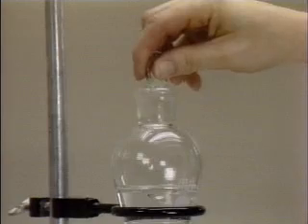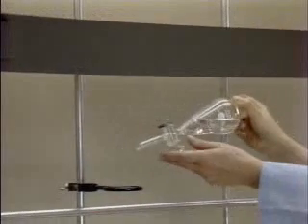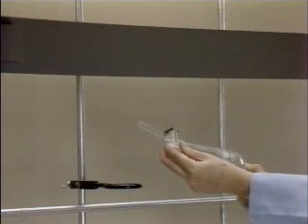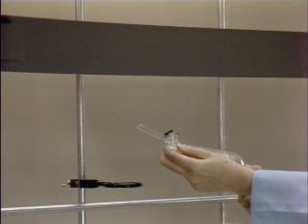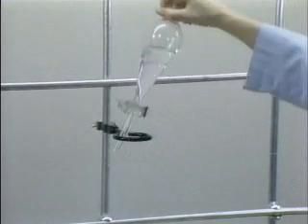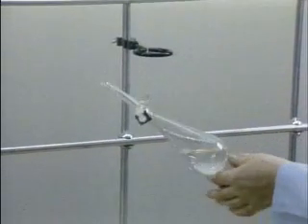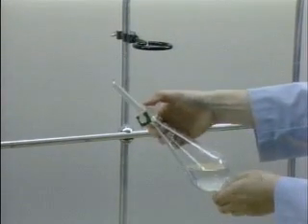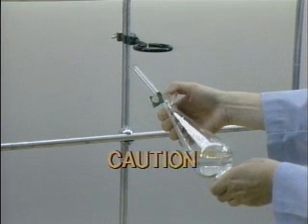The top of the funnel and stopper are grasped tightly with one hand, and the funnel is lifted from the ring stand. As soon as the funnel has cleared the ring stand, the other hand is placed around the stopcock to prevent it from falling out. Immediately after removing the funnel from the ring stand, the tip of the funnel is carefully and slowly raised 45 degrees above the horizontal. Never point the tip of the funnel toward people.